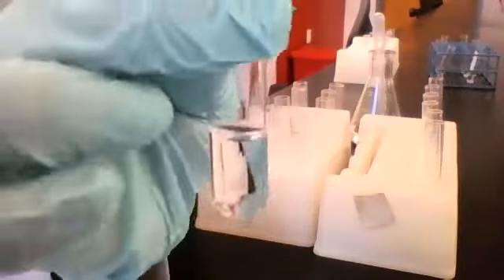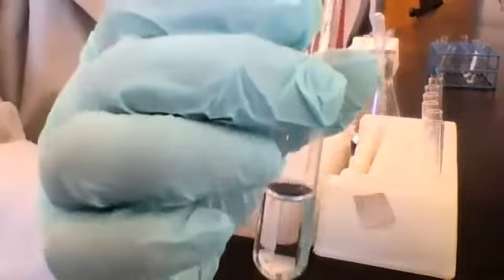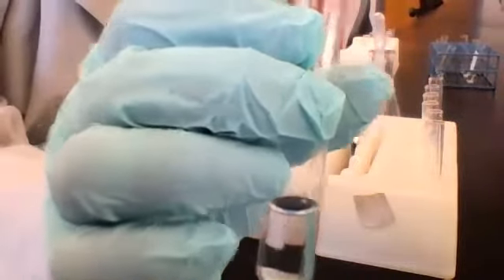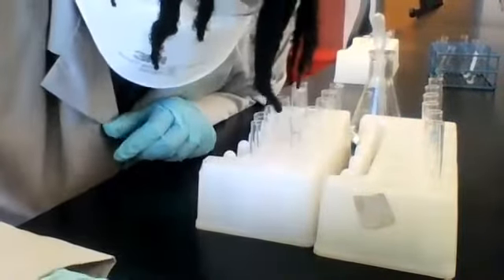Very good. Okay, so this one's NH4Cl, ammonium chloride, combined with sodium hydroxide, NaOH. Right, so let me write those two in the chat for you real quick.